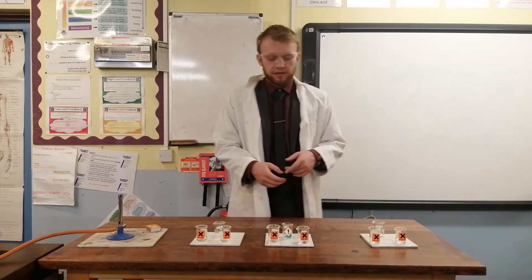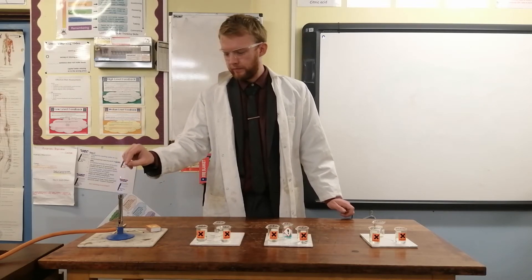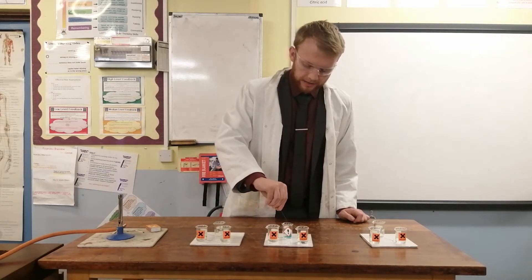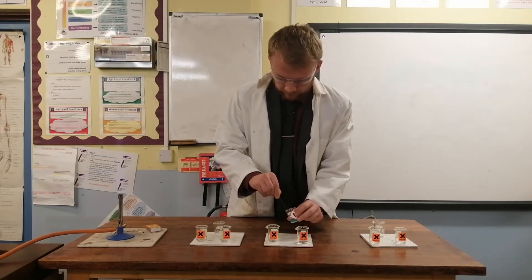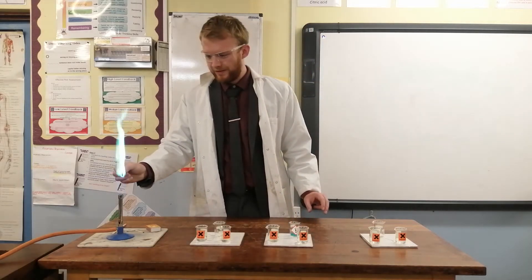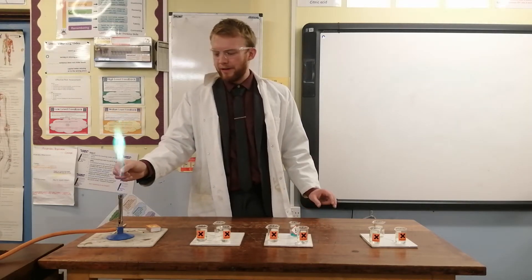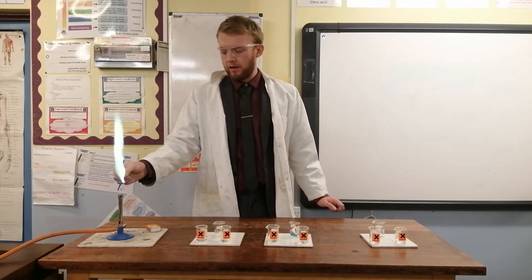Now I'm going to repeat that process but this time for my second unknown metal ion. So with a separate wire I'm going to make sure it's clean. Placing it back in hydrochloric acid, and then into my second sample — I can see that this one gives a bluish green turquoise flame and I know that to be a copper compound.